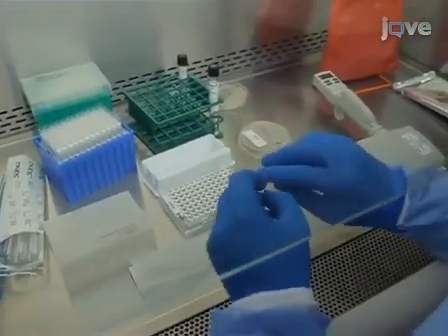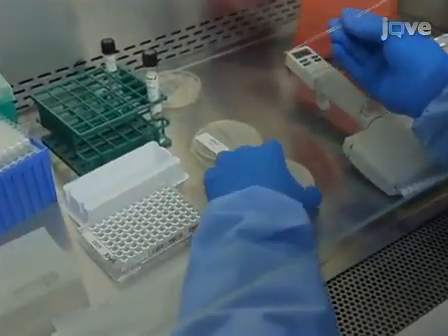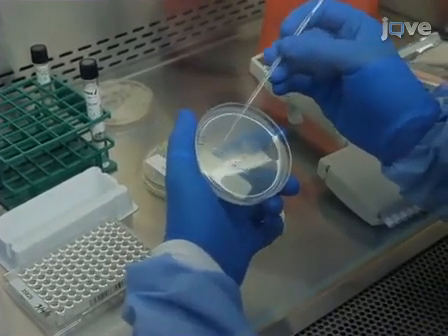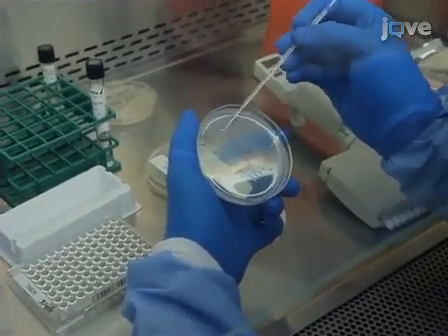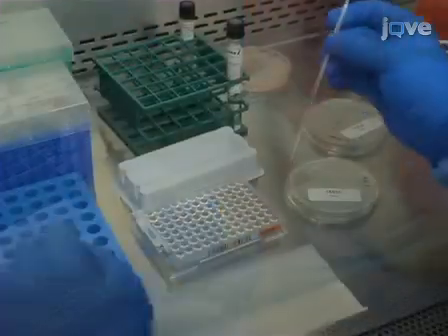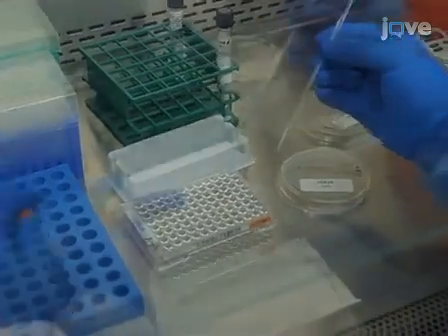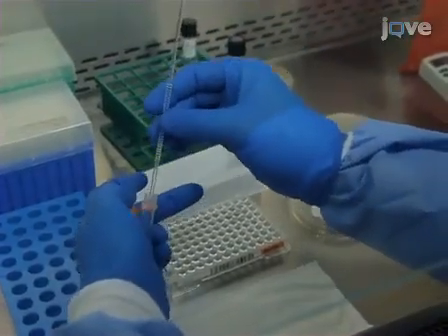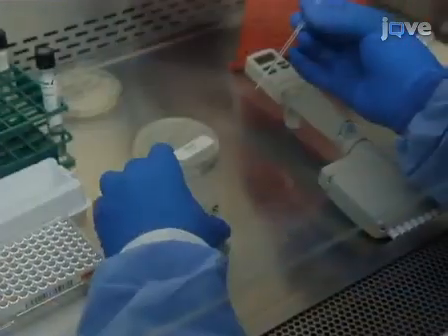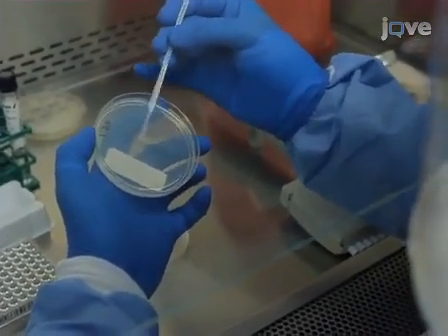Next, prepare plates for performing colony counts. First, prepare an undiluted plate by transferring a 1 microliter loop of sample from the positive control well to the 7H10 plate labeled 1:1. Then use the loop to streak the plate, as shown here. Next, to prepare a 1:50 dilution, transfer a 1 microliter loop from the positive control well and swirl it into the tube with 50 microliters of water. Streak 1 microliter of this dilution on the plate labeled 1:50.